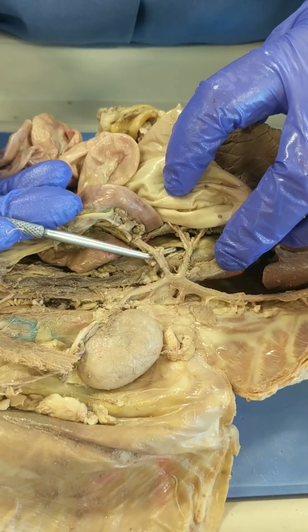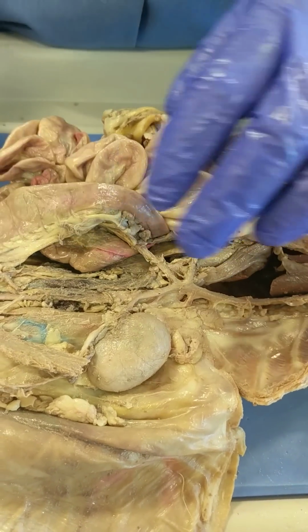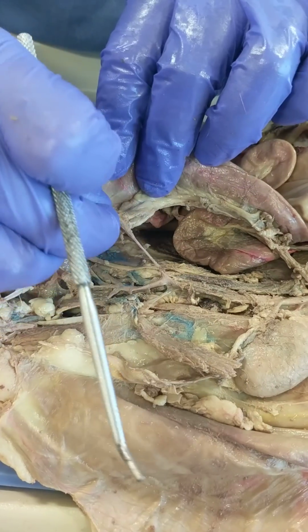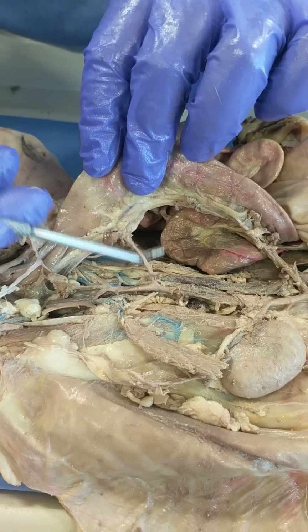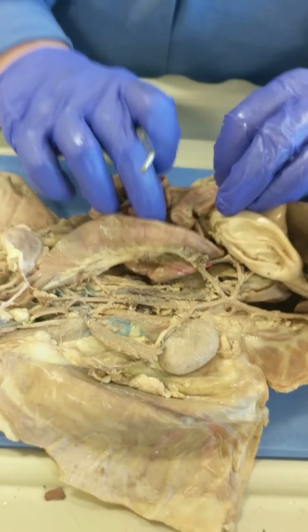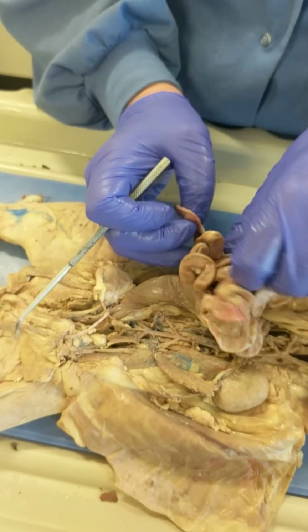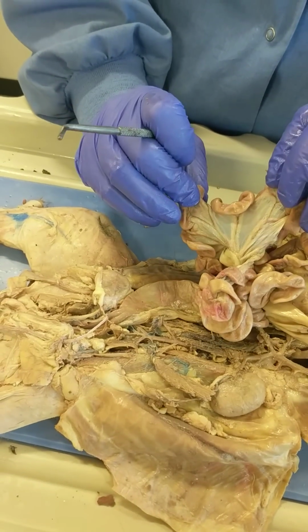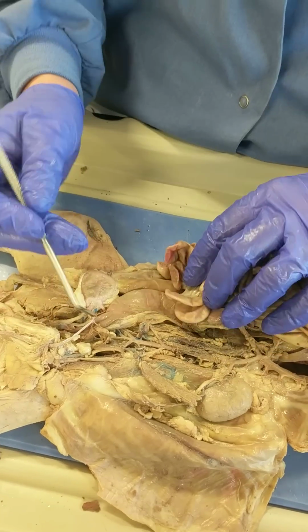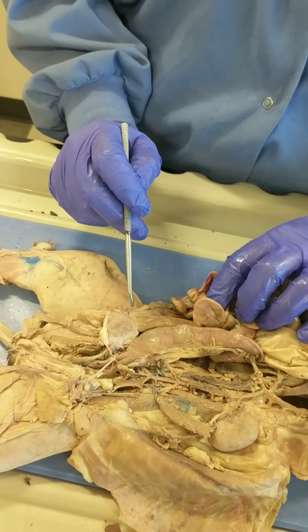And in the cat, it's right next to the superior mesenteric. We call it artery instead of trunk. And then further down, the third one is called, and it's got goop attached to it, which I couldn't get off. Here, this is called the inferior mesenteric. Which reminds me, I did not tell you what mesentery is. Mesentery includes all the membranes that you see connecting the small intestines. So you can tell that there are vessels in the mesentery. Those vessels will come from either the superior mesenteric artery or the inferior mesenteric artery.